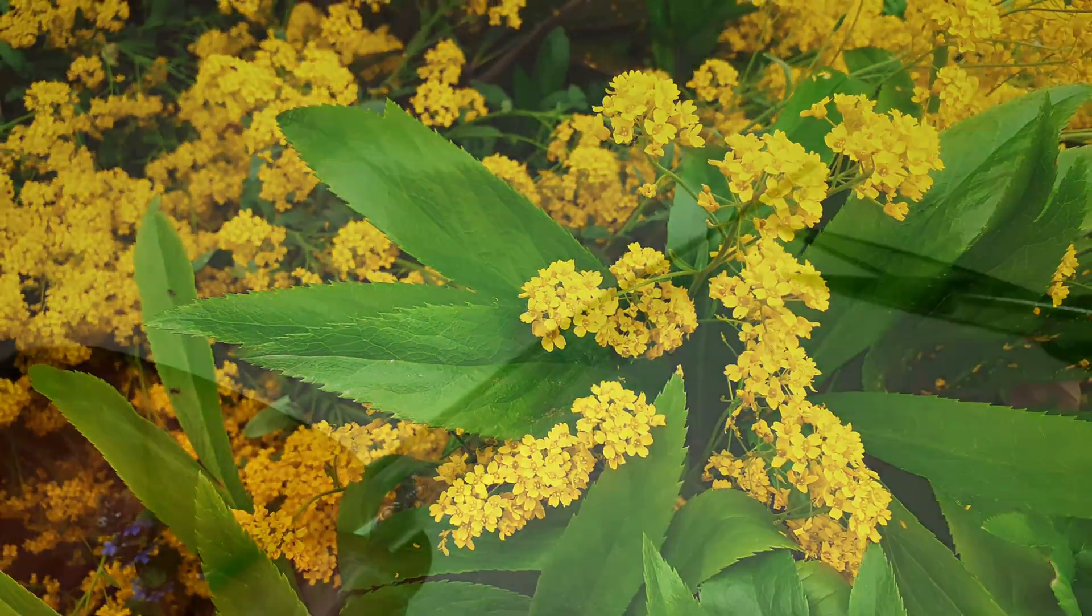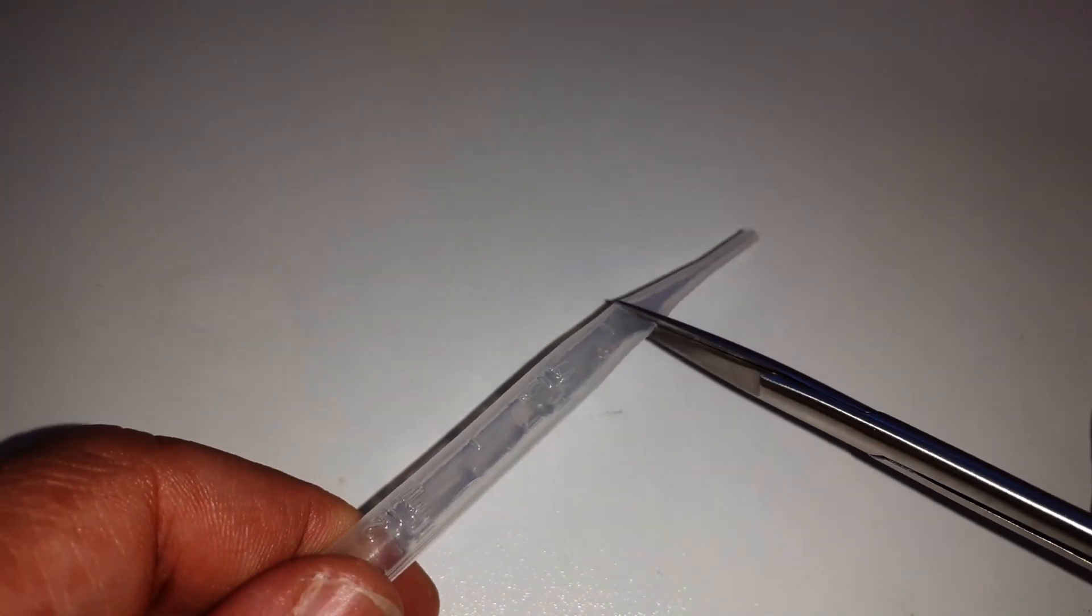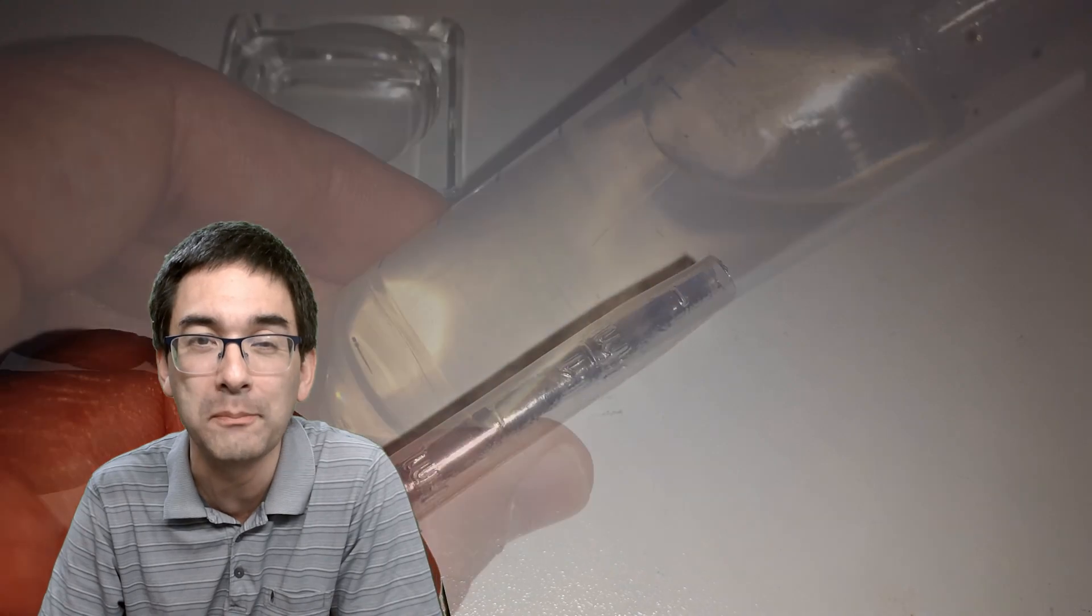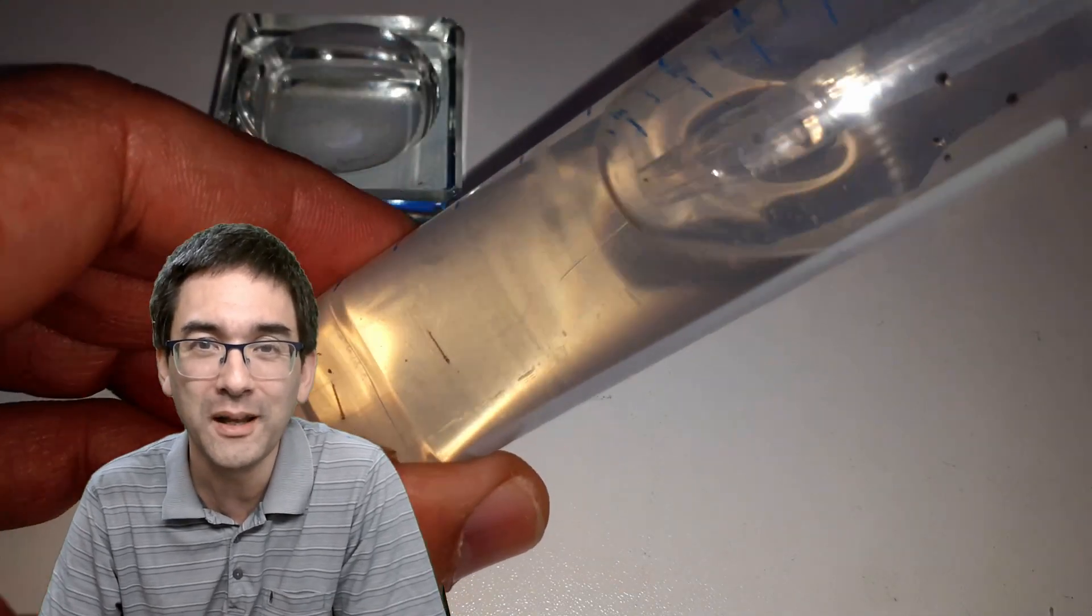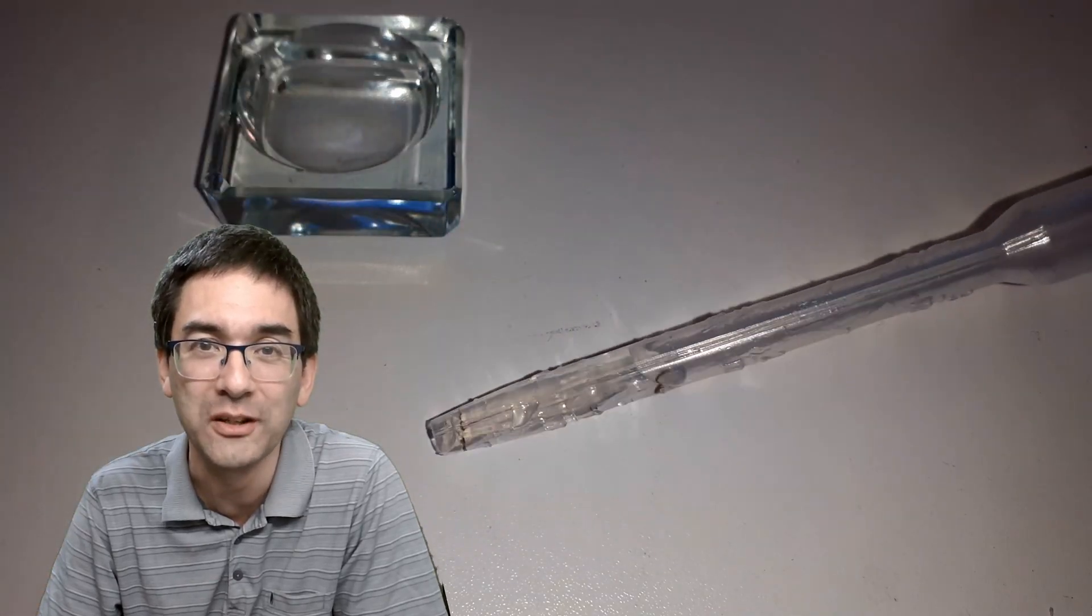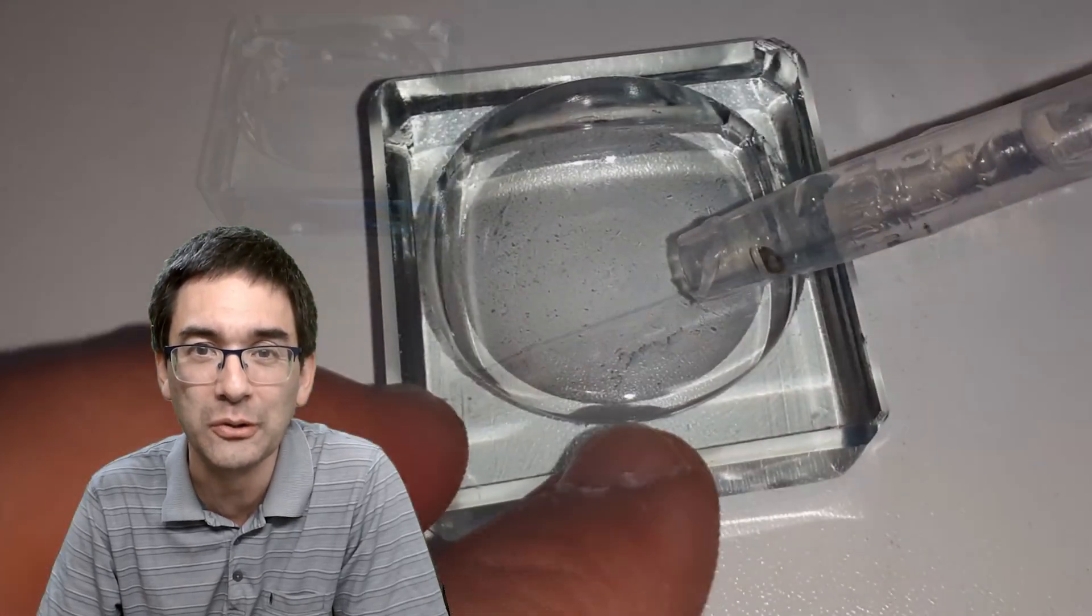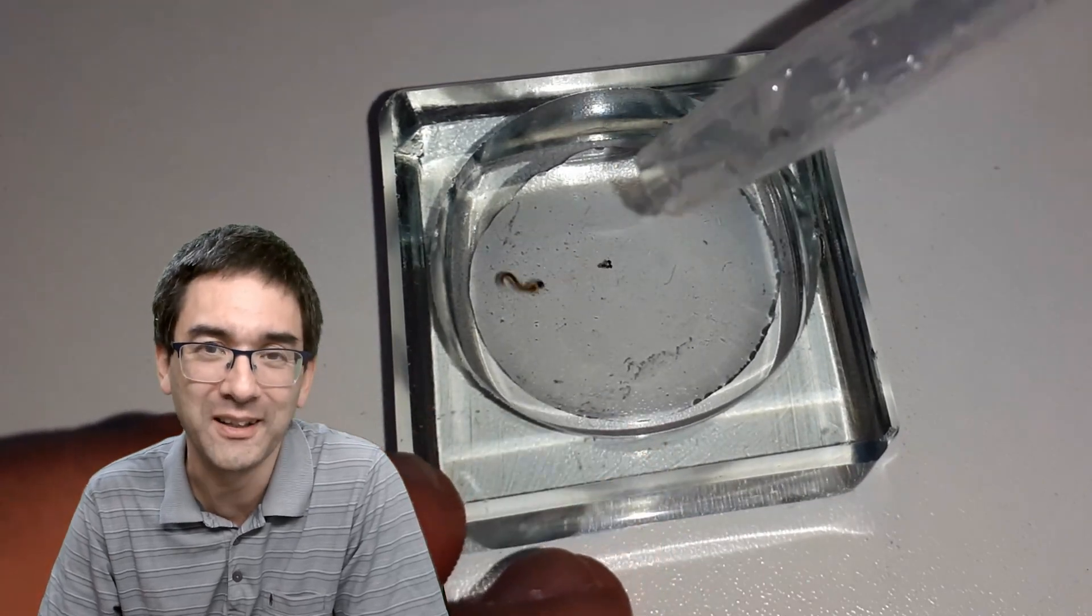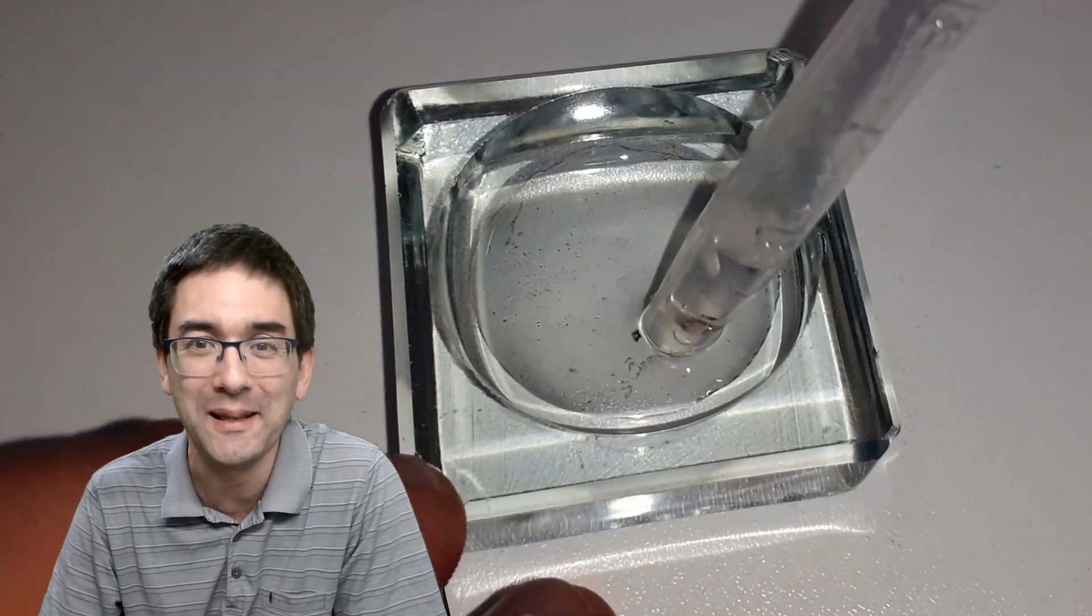Well back at home I wanted to get them out of my plastic tube and I had to cut off the tip of a disposable pipette because the opening was a little bit too small. I was able to pull out two of these mosquito larvae and I had a close look at them first. Well there was only one of them in it first and then the other one was still stuck in the pipette, and here we go.